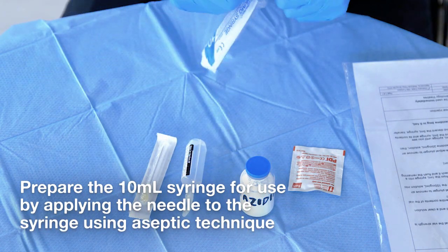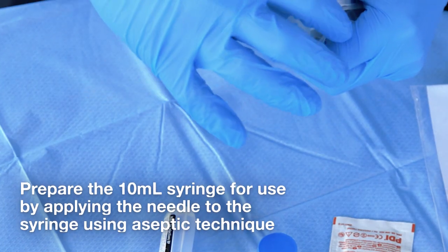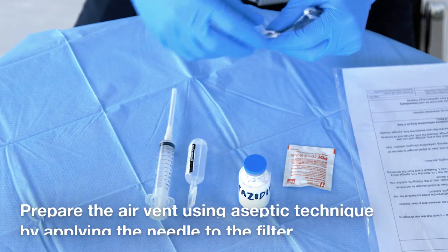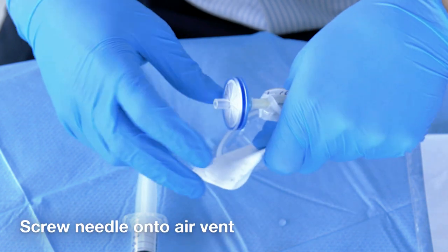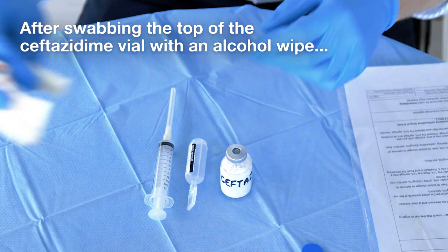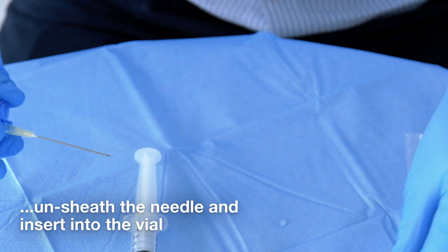Prepare the 10 ml syringe for use by applying the needle to the syringe using aseptic technique. Leave with sheath in place. Prepare the air vent using aseptic technique by applying the needle to the filter. Screw needle onto air vent. After swabbing the top of the ceftazidime vial with an alcohol wipe, unsheath the needle and insert into the vial.